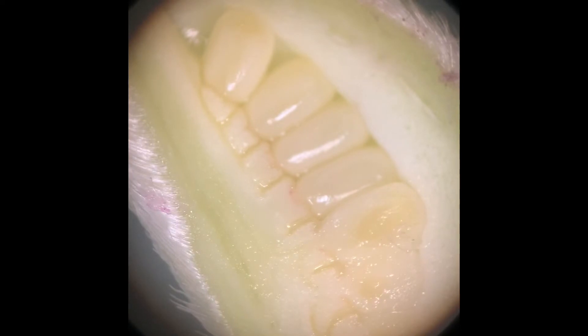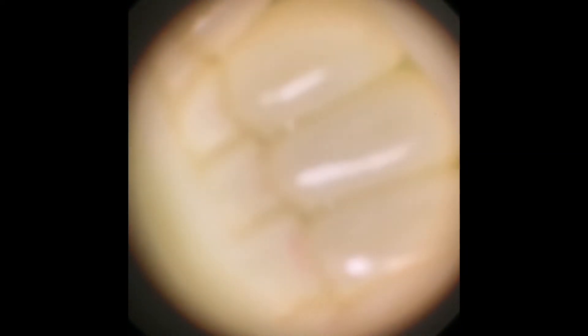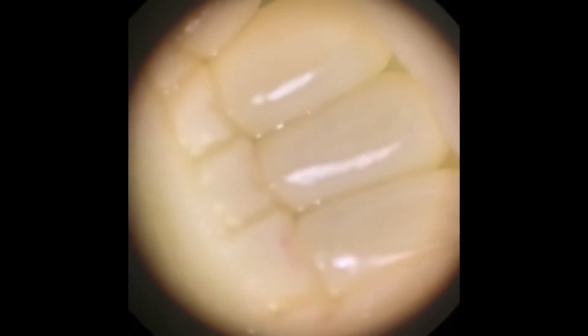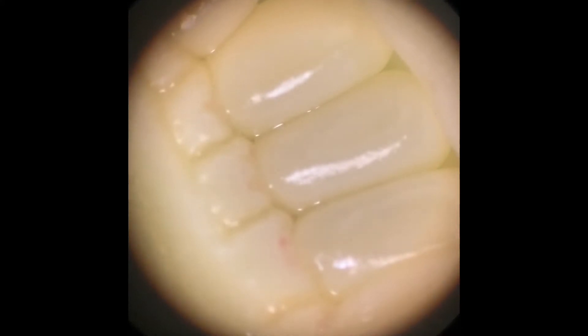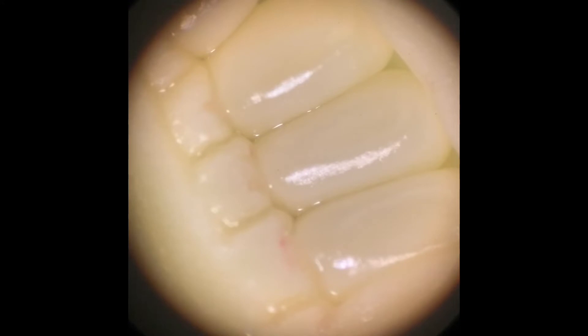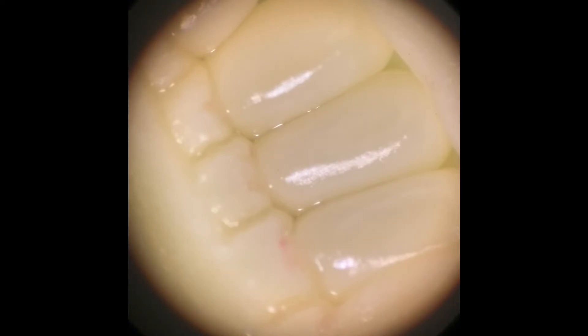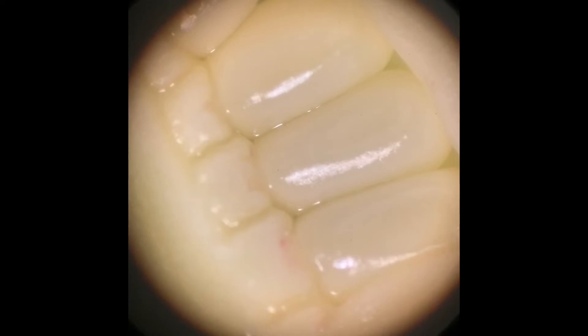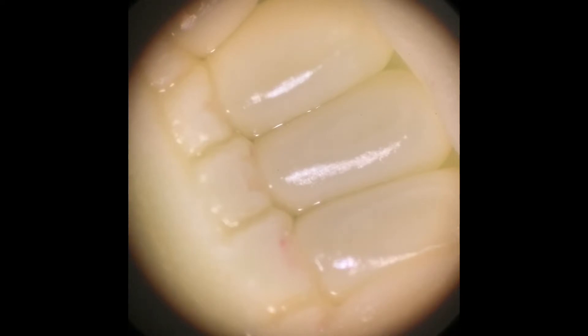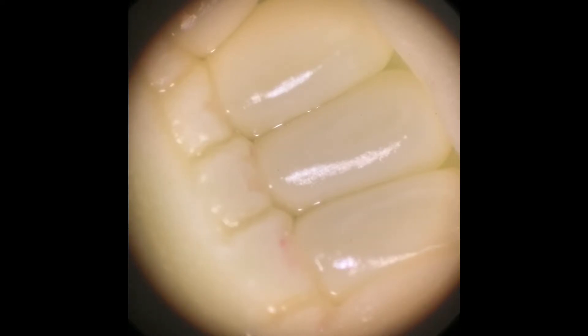Zooming back into focus — the ovules are what turn into the seed that is found within the fruit. If these become fertilized with the sperm, they turn into seeds, and the seeds then grow into a new peony plant.